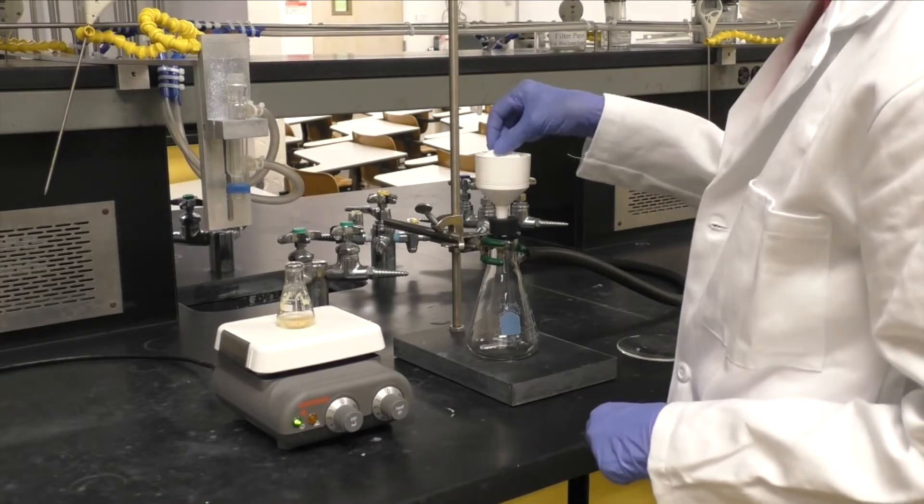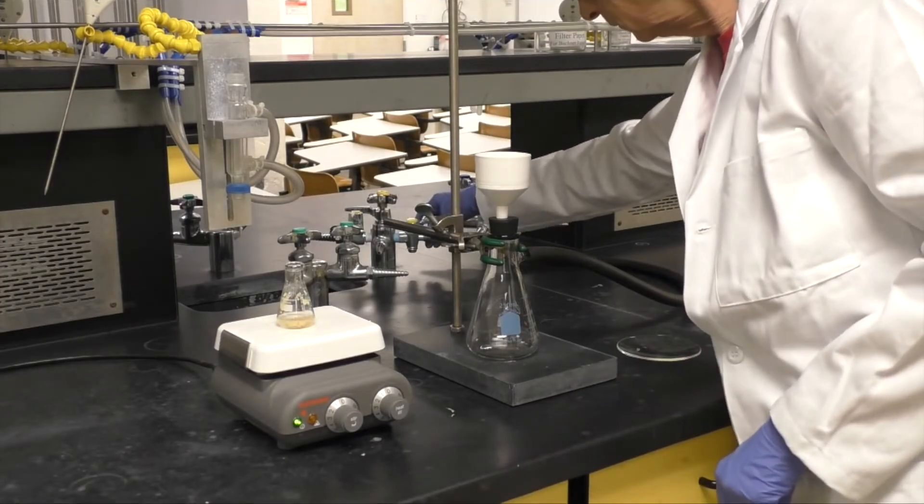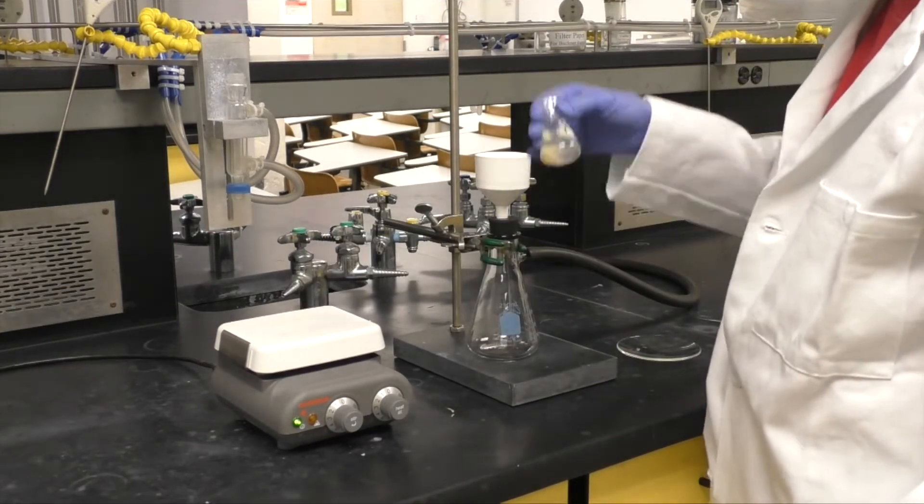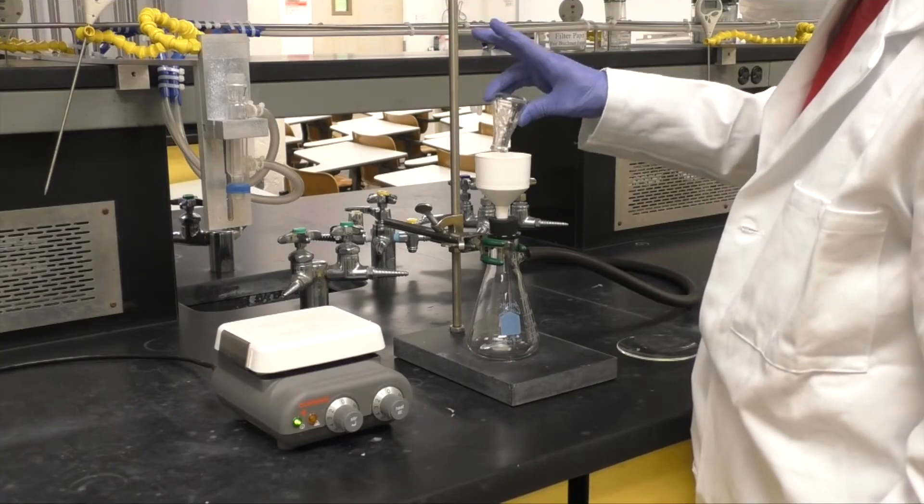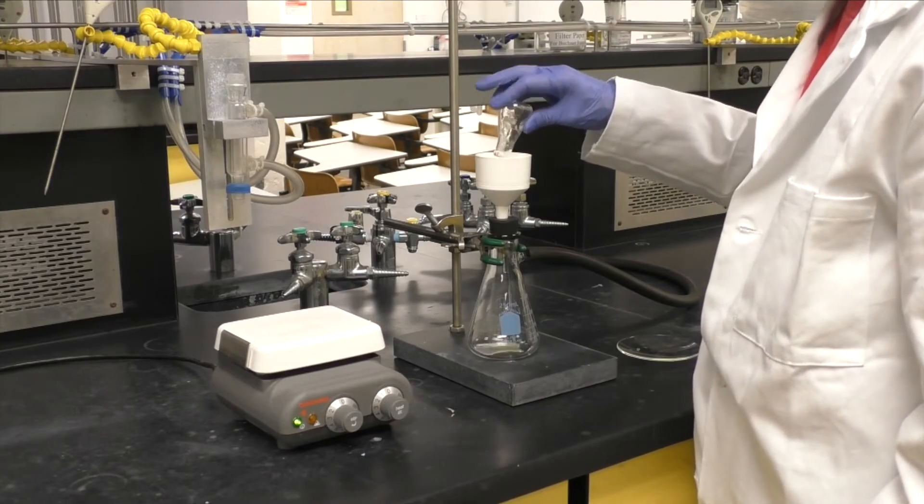Filter your product until dry by letting the vacuum run for about 2 minutes. Weigh the crude product and record the mass. Analyze the crude product by TLC as instructed.